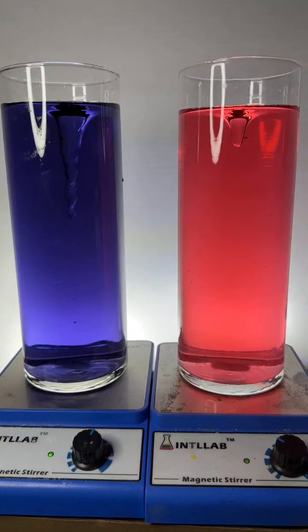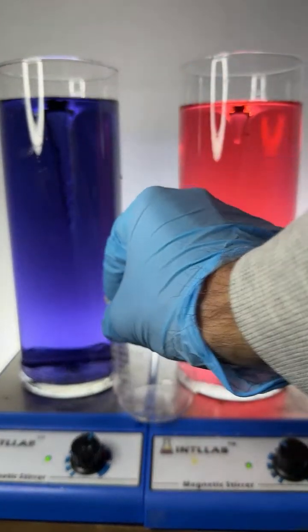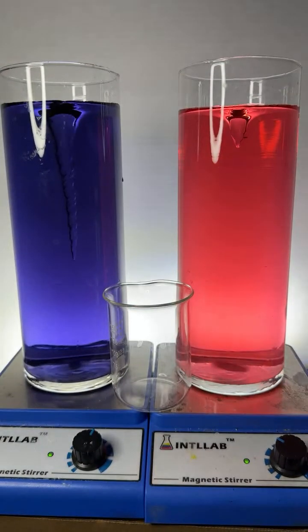Okay. Oh, I got to find a mixing flask. Hold on a sec here, folks. Here we go. I got one. And let's give it a shot. Hey, and it looks like we got over 100 people on here. So because of that, we're going to do a different experiment here after I do this one. I got another experiment planned for us.